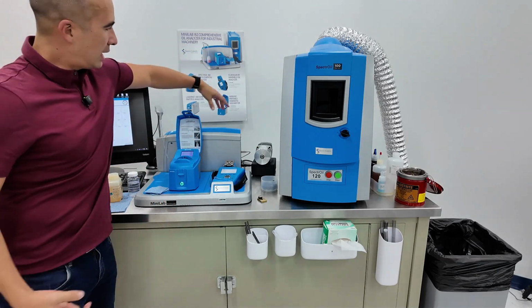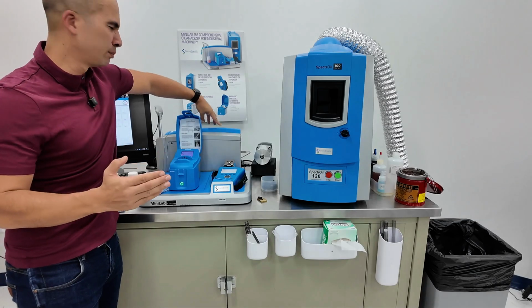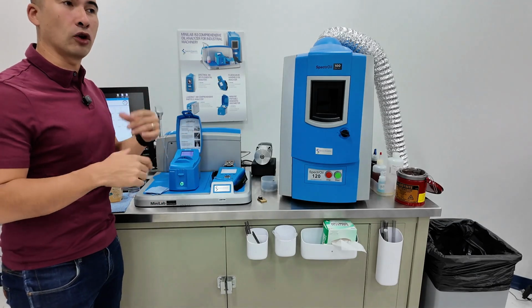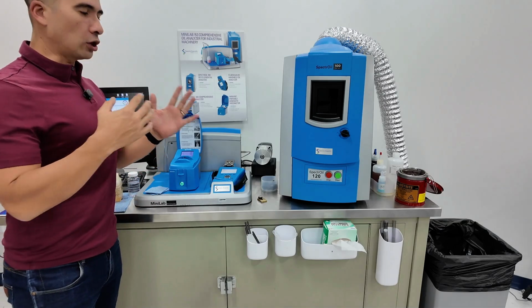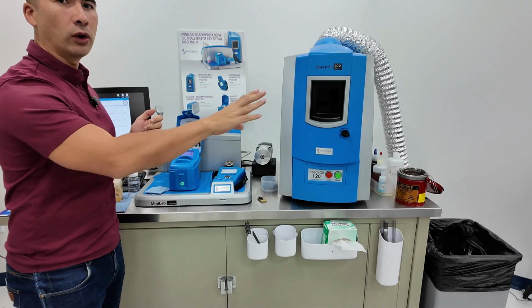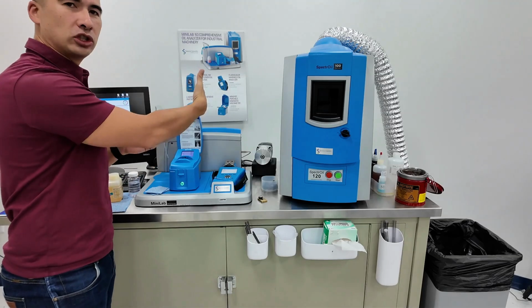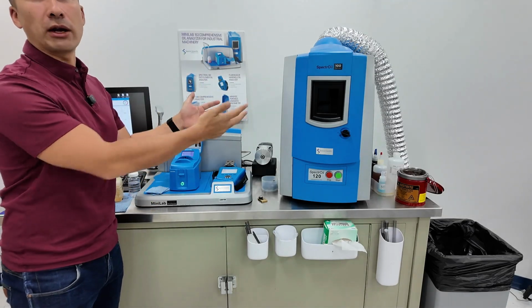At the back here, we have a particle counter which operates on LaserNet Fines. Most people have heard of LaserNet Fines, but may not have actually seen the unit itself. Typical optical particle counts send a stream of oil with a light shining through it, and a detector on the backside sees shadows.